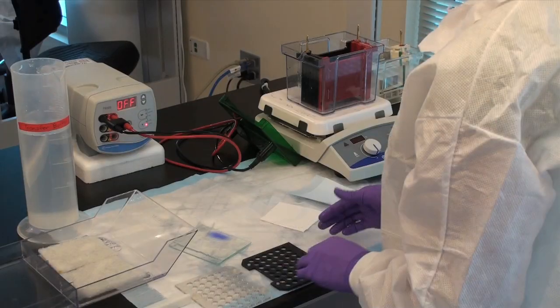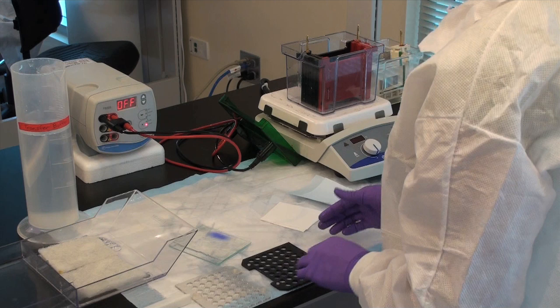Cut a piece of nitrocellulose membrane or polyvinylidene fluoride to gel size. If you use PVDF, be sure to charge it in 100% methanol.